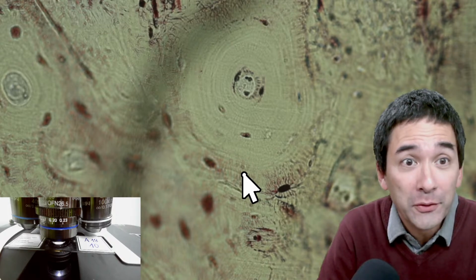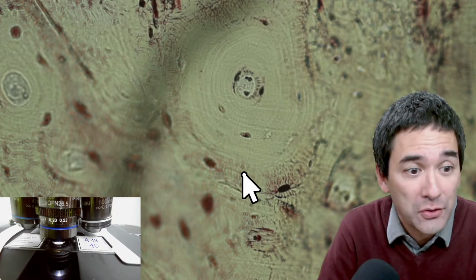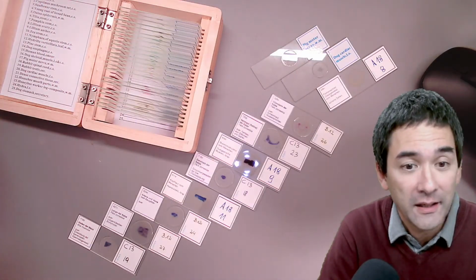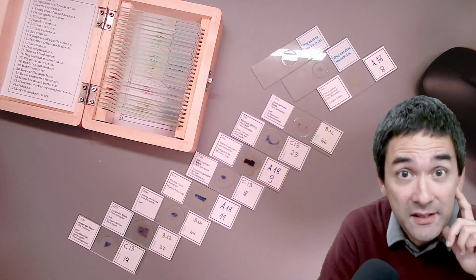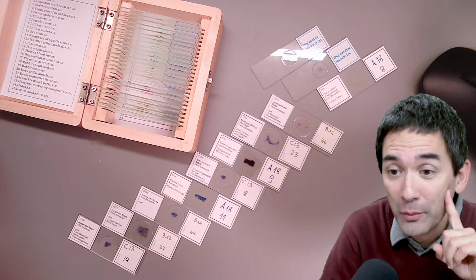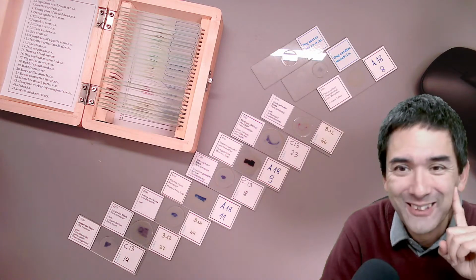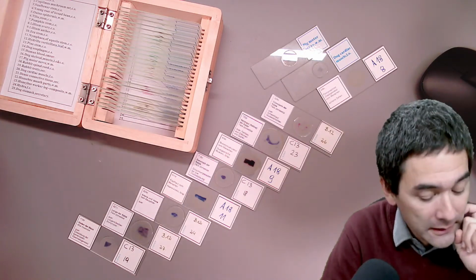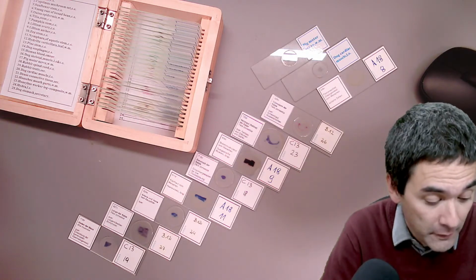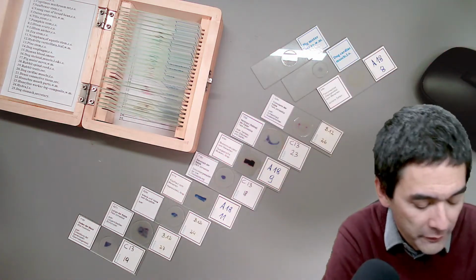Well, what am I going to do today? Today I would like to look at a few microscope slides that I've got here, permanent slides. These are commercial permanent slides. Hello, everyone's commenting right now. Okay, great, seems to work. Yes, I'd like to look at a few commercial permanent slides today. I've chosen a few of them.